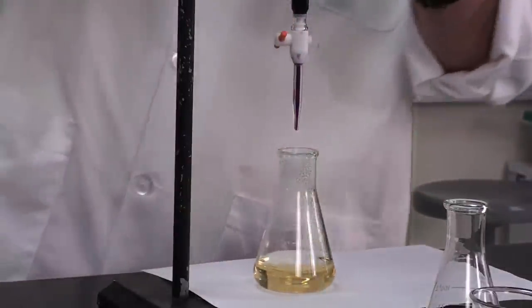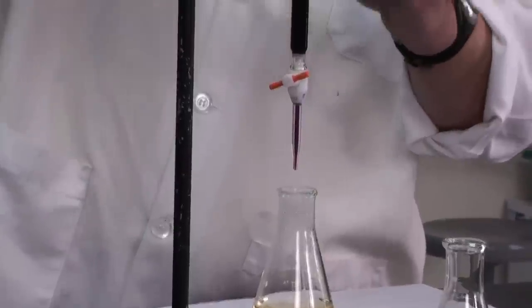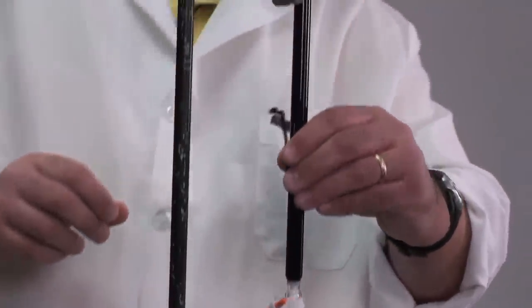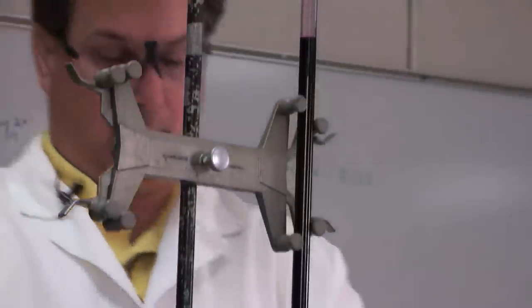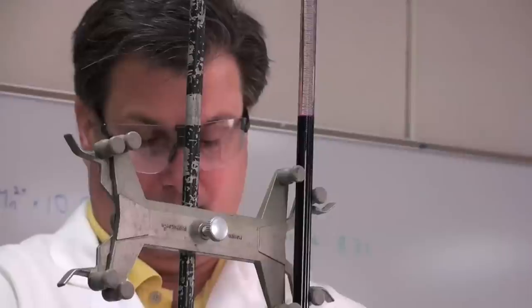As a little exercise on your own, you might want to see if you can repeat that calculation. So I know I've still got a ways to go here, but I'm going to continue to go slow. Check my volume here, see how we're doing. We're a little below 18 now, so we are probably roughly halfway to where we need to be.